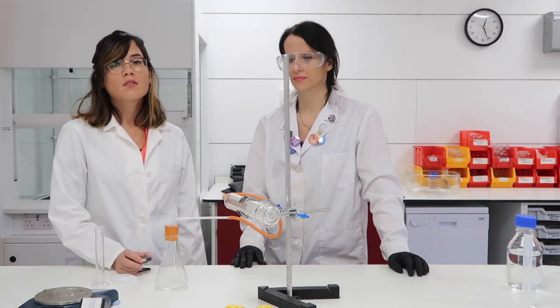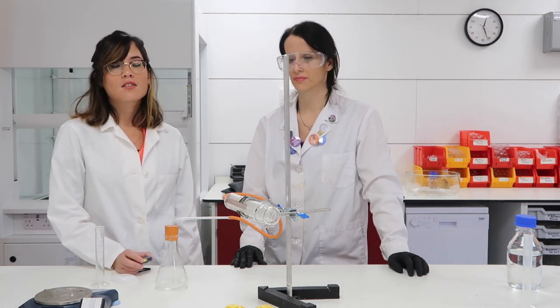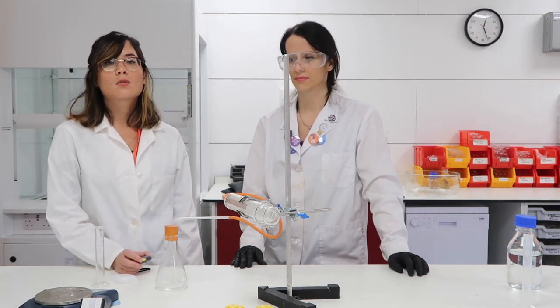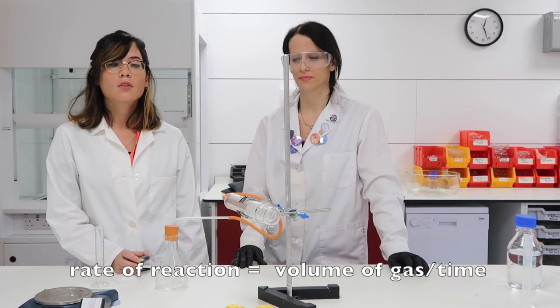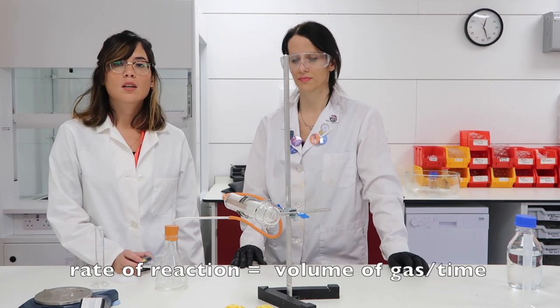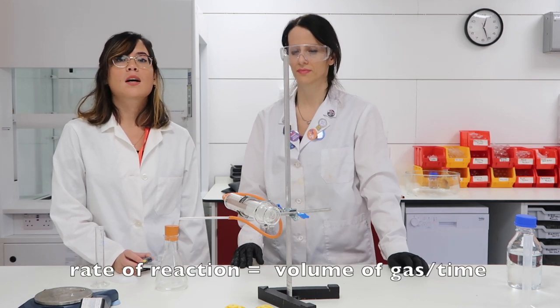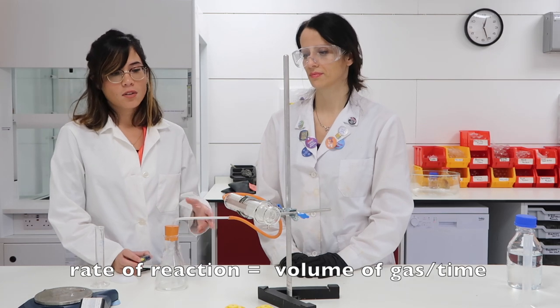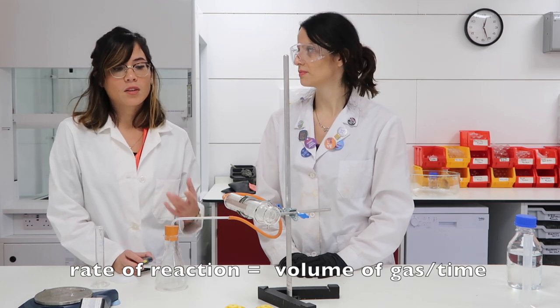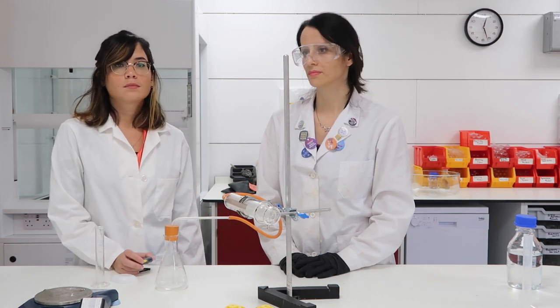We can obviously calculate rates of reaction. To do that, just do change in volume divided by the time, which is 30 seconds. So for this experiment it would be 5 divided by 30.